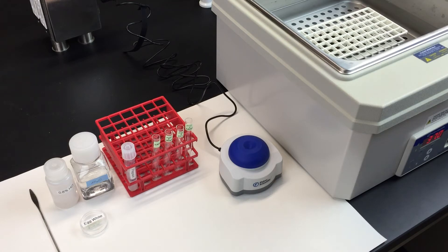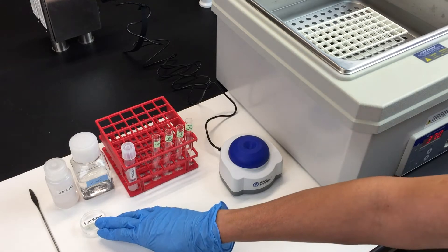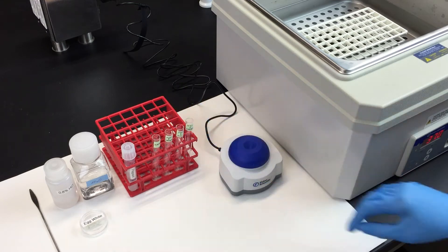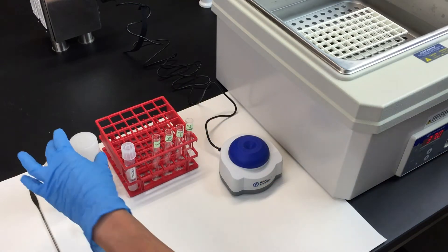For this part of the experiment, we're going to look at protein digestion. We'll use boiled egg white as the protein and pepsin as the digestive enzyme. Set up four test tubes. The first will have five milliliters of water only.